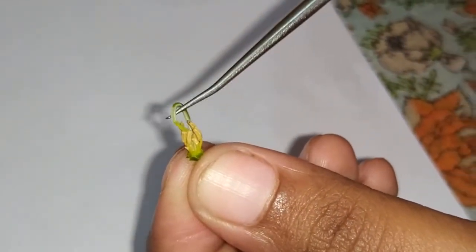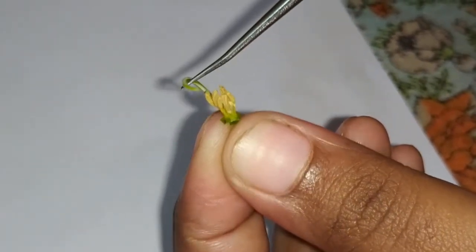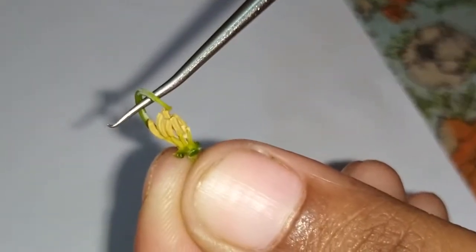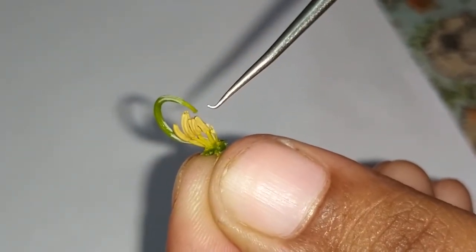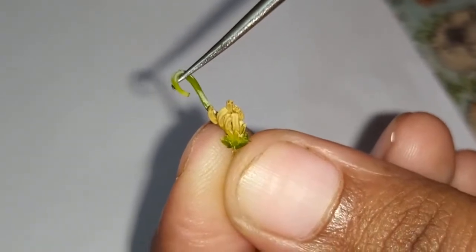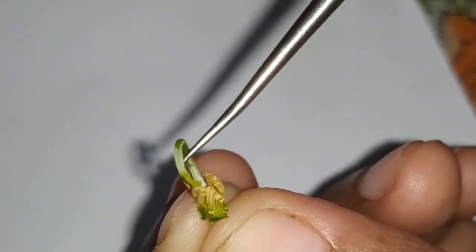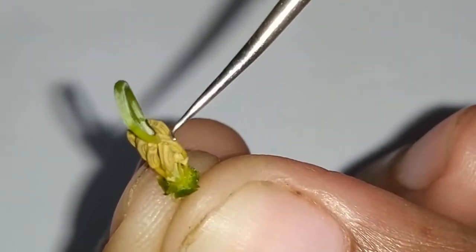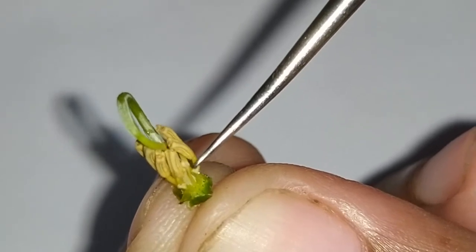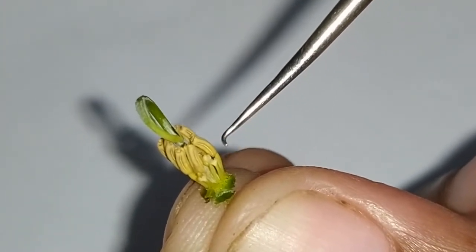Now let's come to the essential whorls of the flower — the androecium and gynoecium. You can see that the anthers are basifixed and bilocular. The anthers are on the filament, that's why it is called basifixed anther. The anthers are in two locules and the total number of anthers is 10. Out of 10, seven are fertile and three are staminodes — the filament is there but the anther lobes are absent. These are called staminodes.